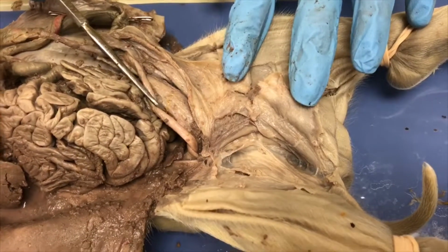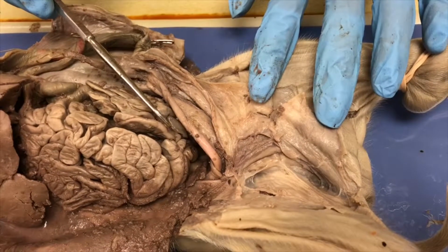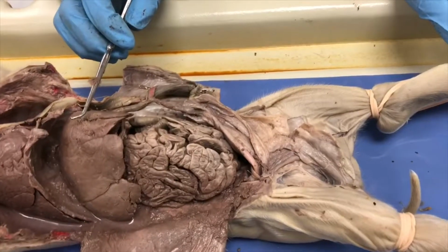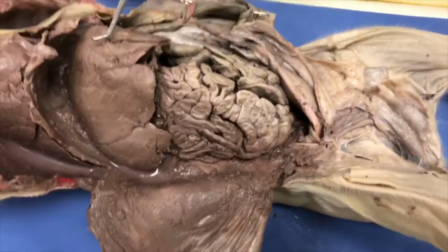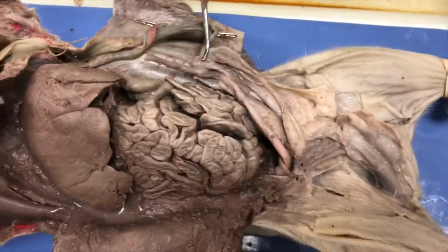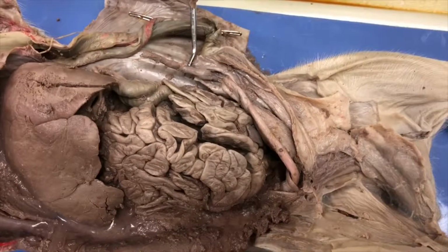The urinary bladder is also a muscular reservoir that can expand many times the relaxed size to accommodate large amounts of urine. Notice the unusual shape of the bladder in the fetal pig. The unusual shape is due to the nature of the fetus' reliance on the allantois to store metabolic waste outside of its body. As soon as the fetus is born, the umbilical cord here deteriorates and the fetus no longer eliminates waste through the allantoic stalk.